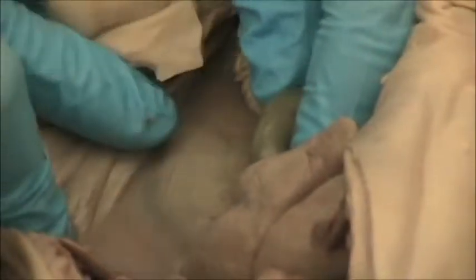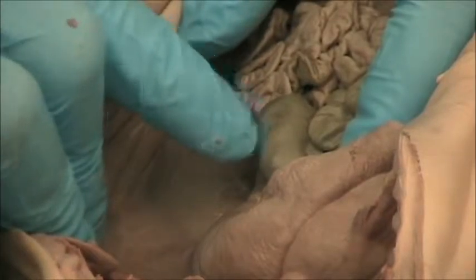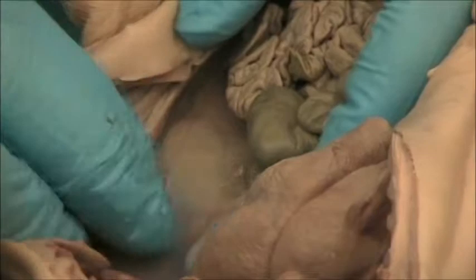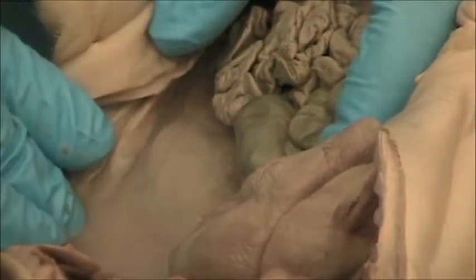We say that the kidney is going to be retroperitoneal. In other words, behind the peritoneum. You can see that if there was an infection from, let's say, a burst colon or an ulcer in the small intestine or an ulcer in the stomach, you might get bacteria in the abdominal cavity. Because the kidneys are retroperitoneal, they would be protected from such an infection. So what we want to do now is just basically cut through the peritoneum so that we can show that indeed the kidneys are retroperitoneal.